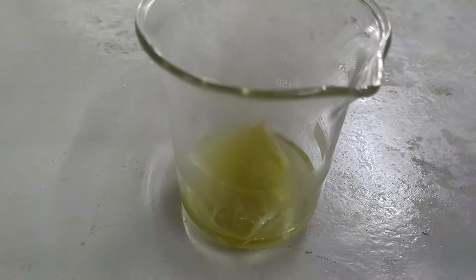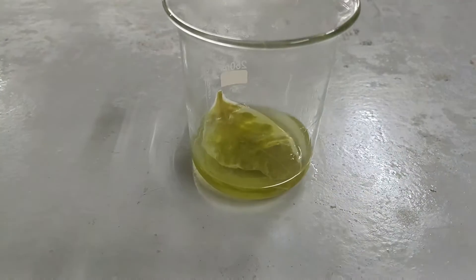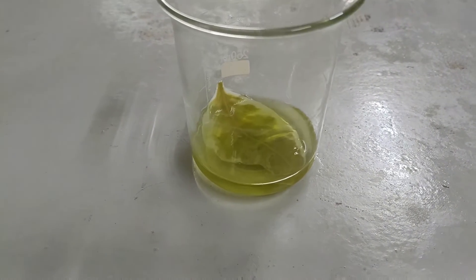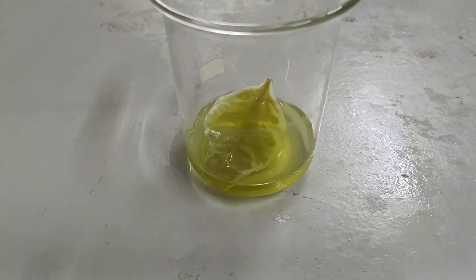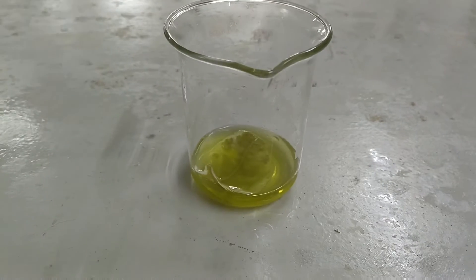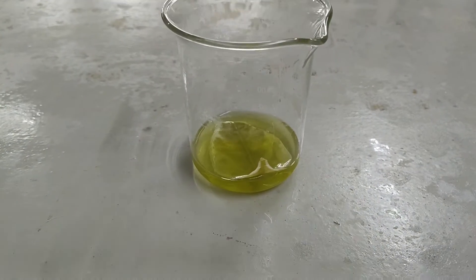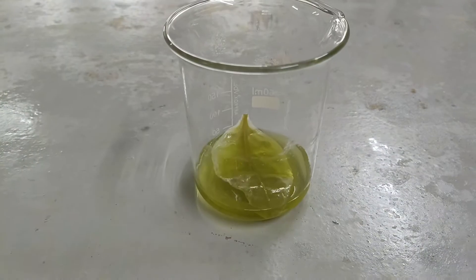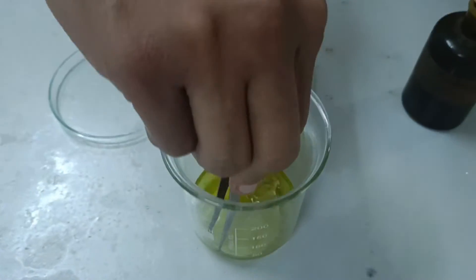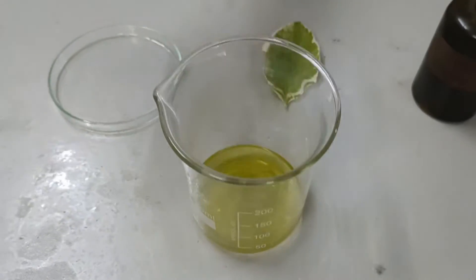We notice that the colorless alcohol starts to turn green. This happens because the chlorophyll is being sucked out of the leaf into the alcohol.